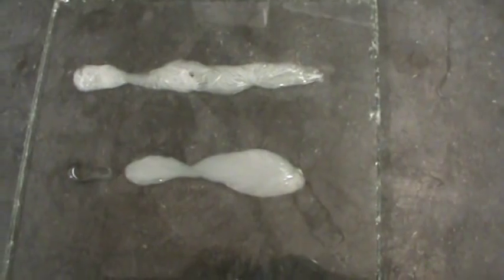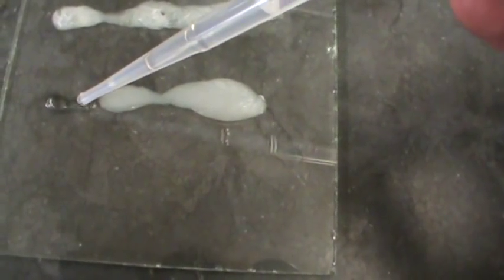Very reminiscent of the crystal effects markers. I didn't jump across there, of course, because those aren't touching. So I'm going to go ahead and connect them here. And there we go. It's beautiful.